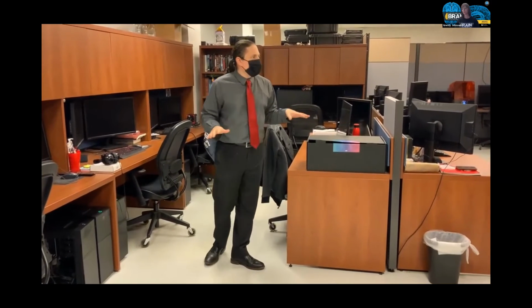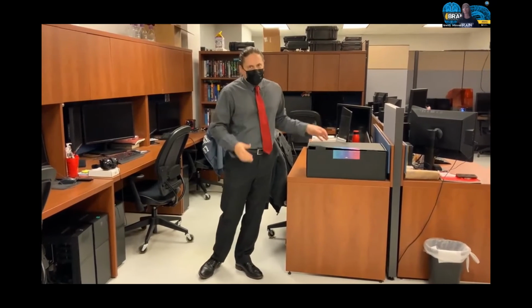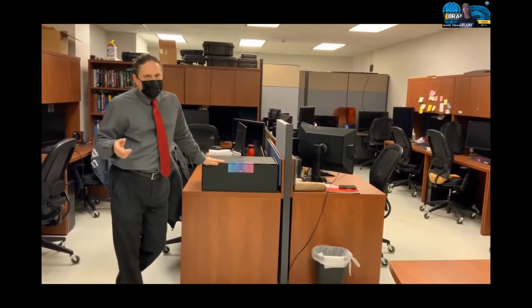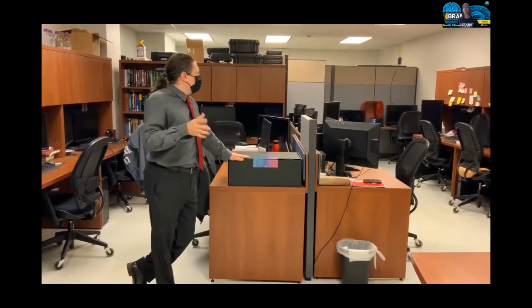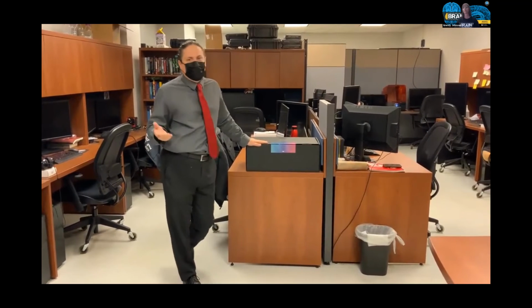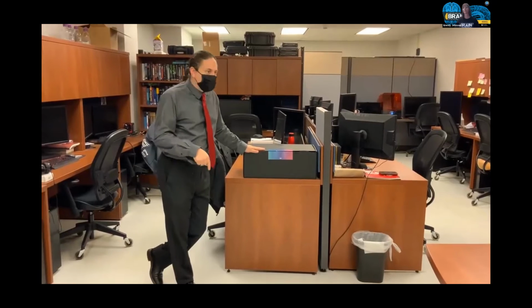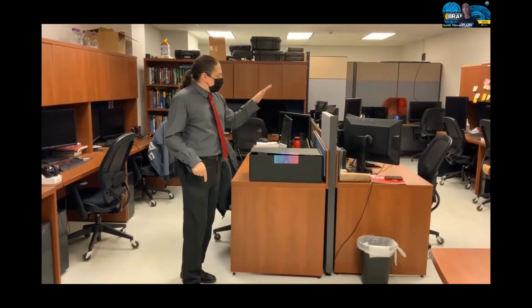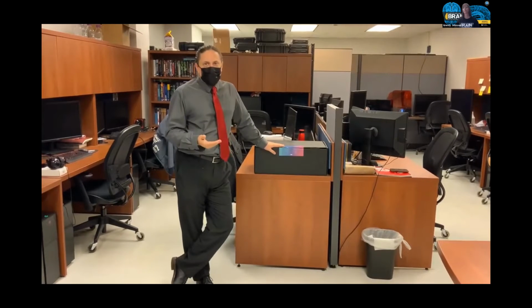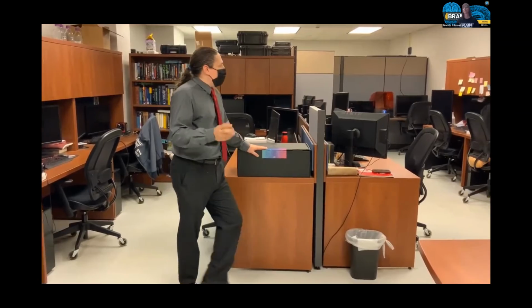So here we have an office space that is equipped with workstations for up to around 13 students. Each of the workstations are designed to facilitate parallel computing, so they're all equipped with CUDA-compatible GPUs. We also have a VR setup for some recent visualization projects that we're working on for three-dimensional tissue visualization.